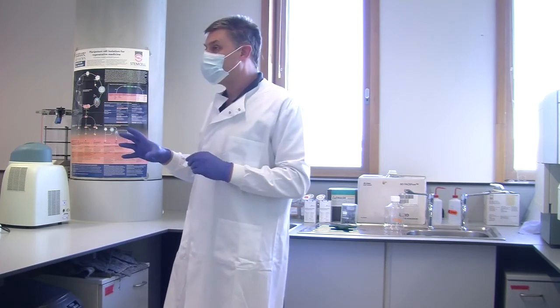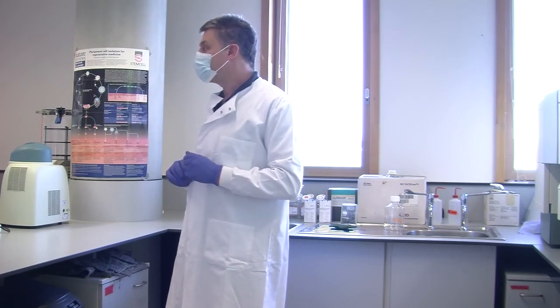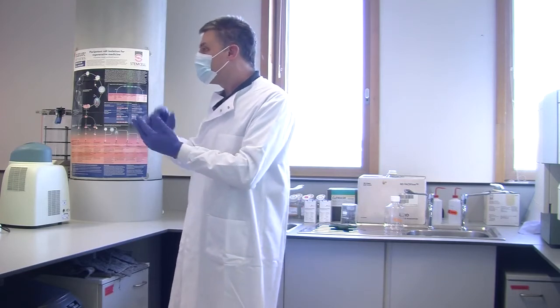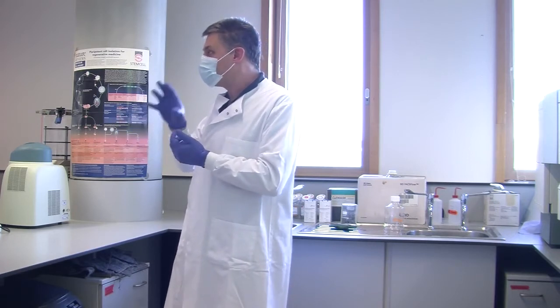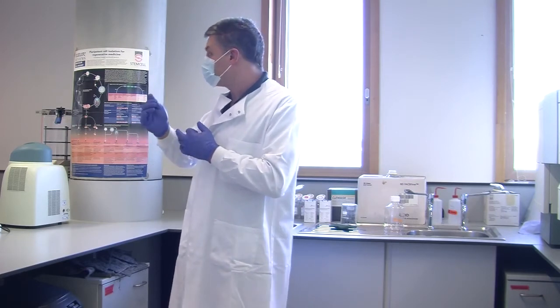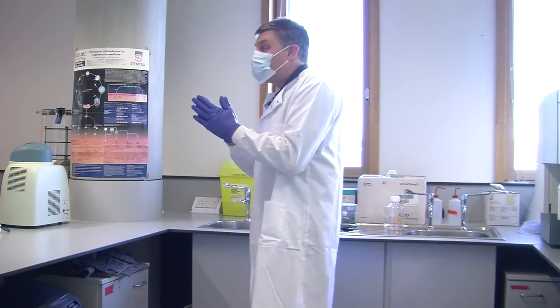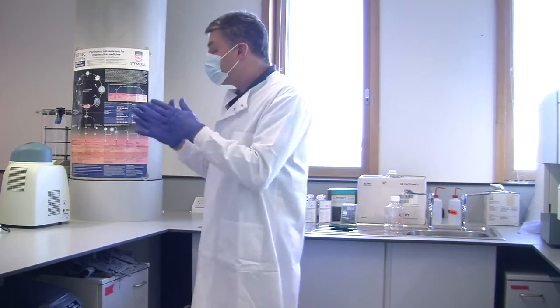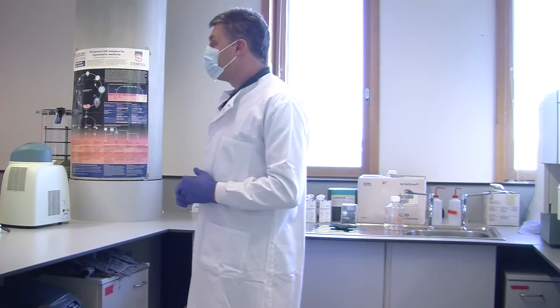And I was reading a paper the other day, and they appeared to have no neutrophils or granulocytes at all. But the paper didn't comment on it. So I'm reading it thinking, someone somewhere has messed up, because that is not whole blood. That can't be whole blood. I do not believe that this patient has no neutrophils, granulocytes, or whatever, and it isn't remarked on somewhere. You do get patients like that, but that's quite a noteworthy thing to put in the paper. You don't say, we took blood from our normal donor and it showed this. No, it didn't. But I see that because my brain says, this is what I tend to see. So it is getting used to it.